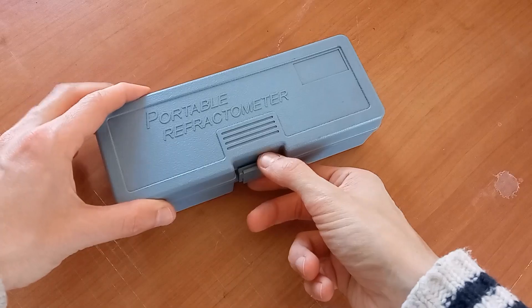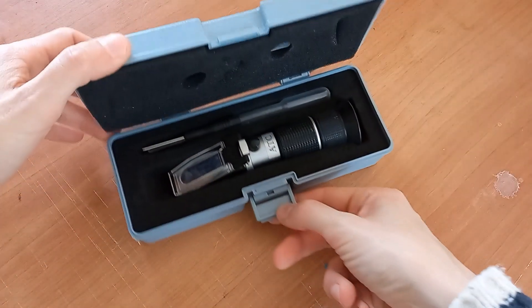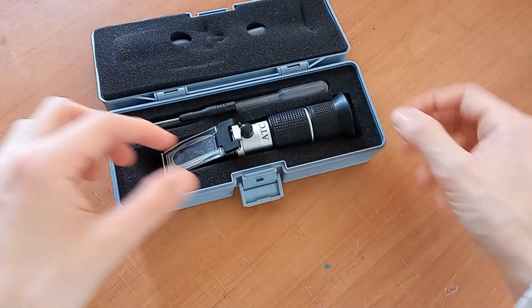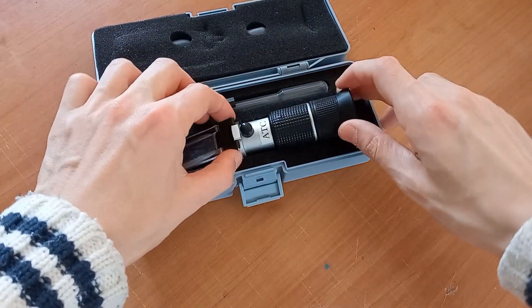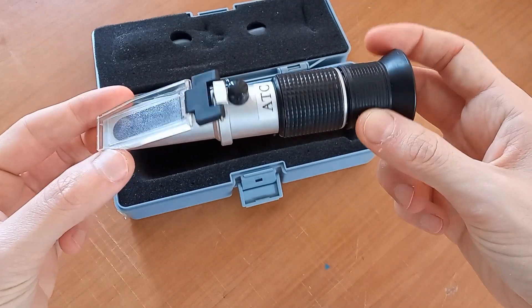This is a low-cost optical refractometer. It cost about 50 euro, purchased from the web. It is composed of a prism, cover and lens from which measurements are read.